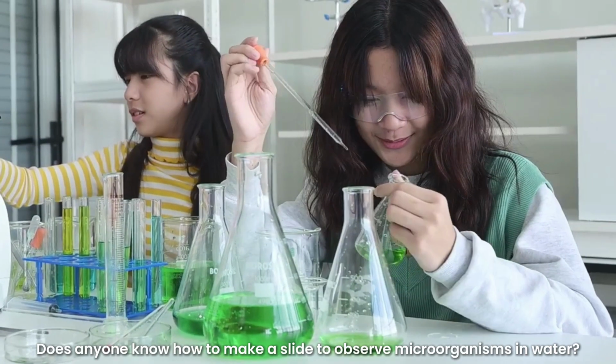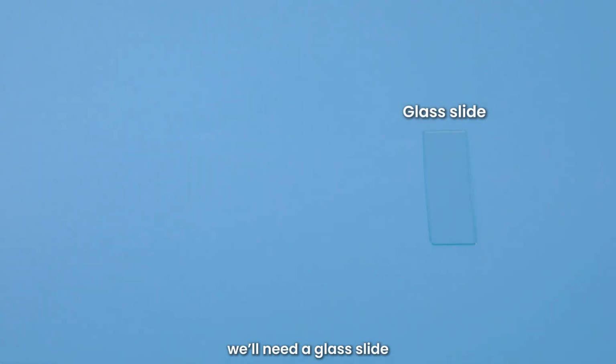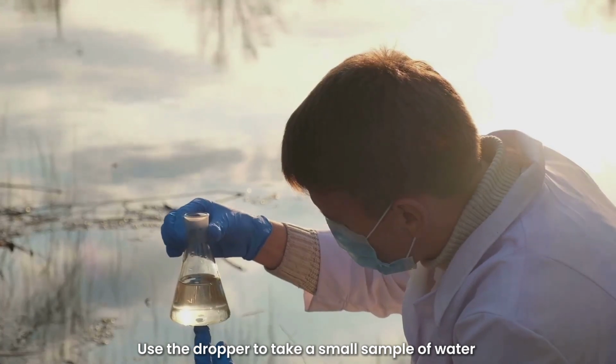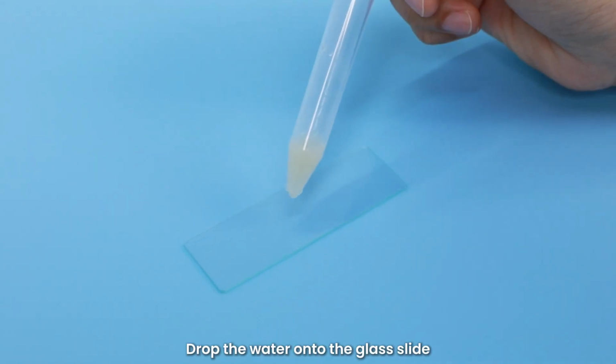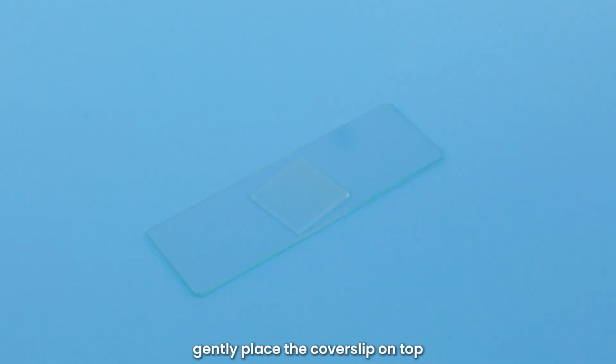Does anyone know how to make a slide to observe microorganisms in water? First, we'll need a glass slide, a cover slip, a dropper, and tweezers. Use the dropper to take a small sample of water from a pond or a potted plant. Drop the water onto the glass slide, and then, using the tweezers, gently place the cover slip on top.